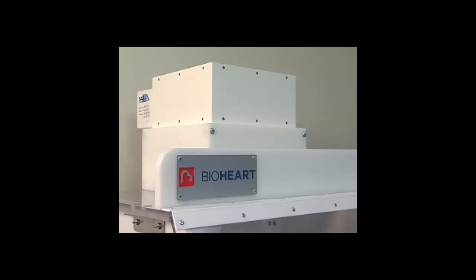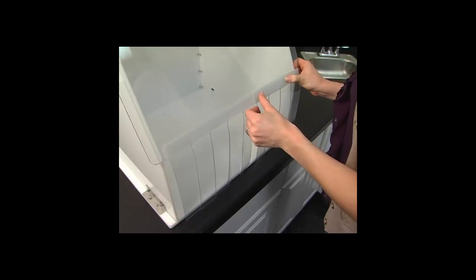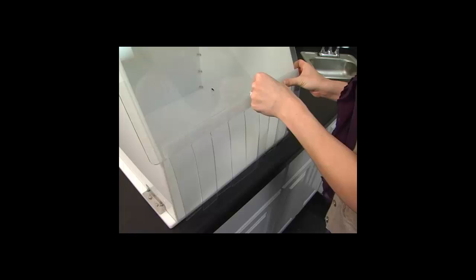Now you are ready to install the air cleaner to the top of the hood. This is best done using two people. Make sure to carefully set the air cleaner assembly into the square chassis housing on the top of the hood.